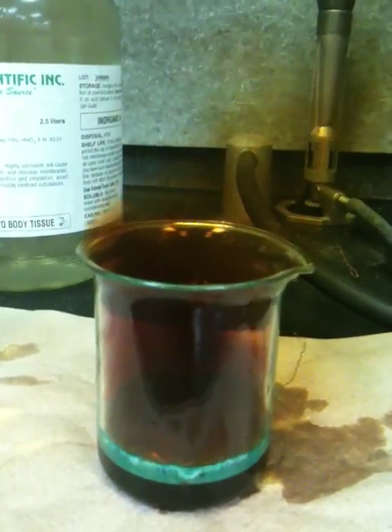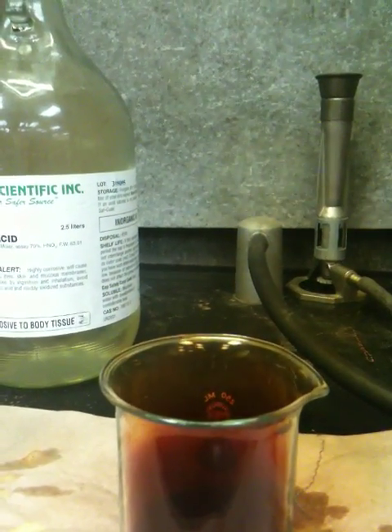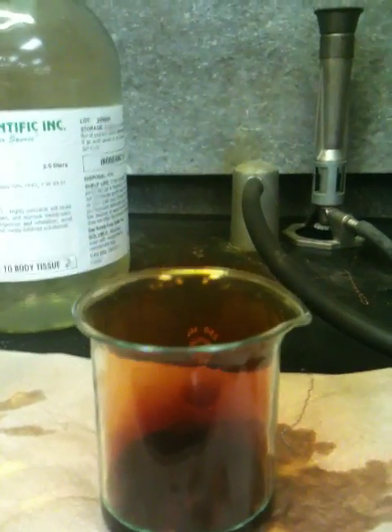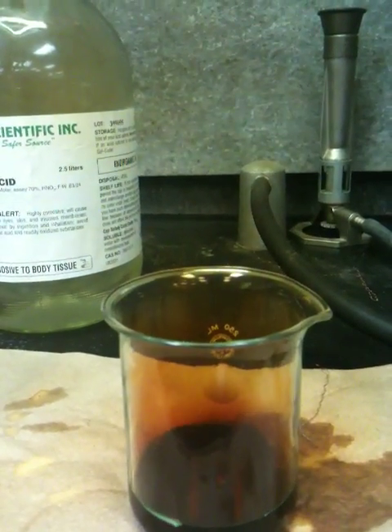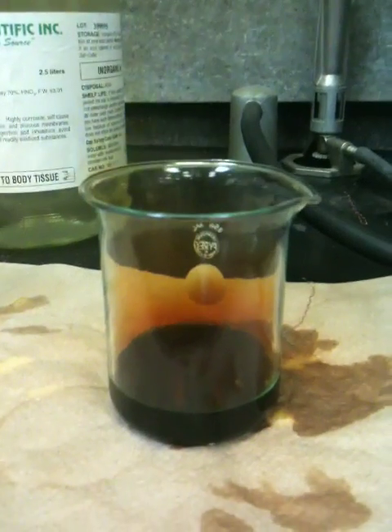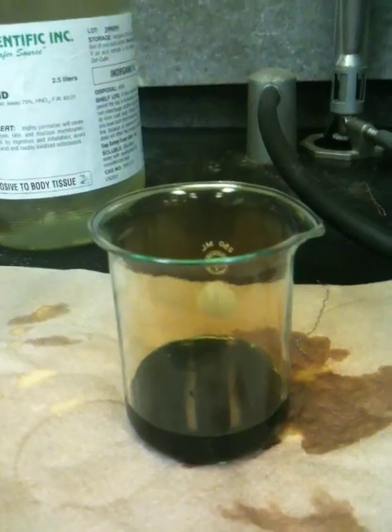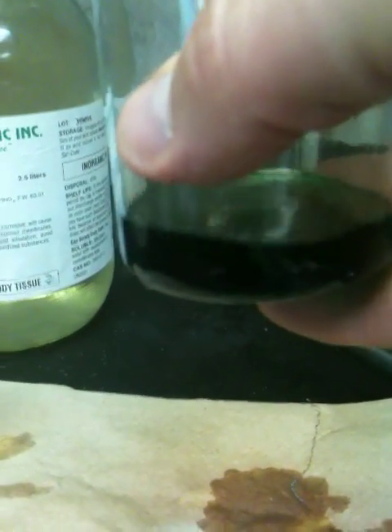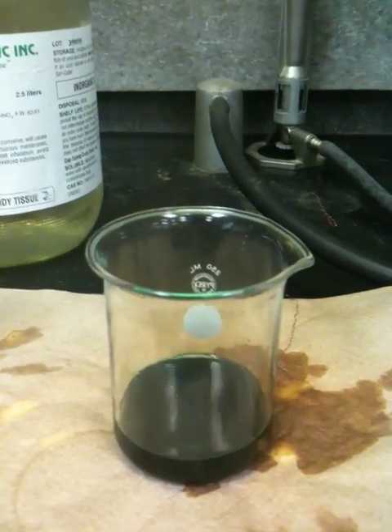You can see it's really going to town here. Basically what's happening is the nitric acid reacts with the copper to form copper nitrate — copper is now an ion, and that ion has a totally different kind of physical appearance. In fact, it has no appearance at all except for the color in the solution. Right now it looks really dark because we're still in the reaction, and the bottom of that container is hot because this is an exothermic reaction.